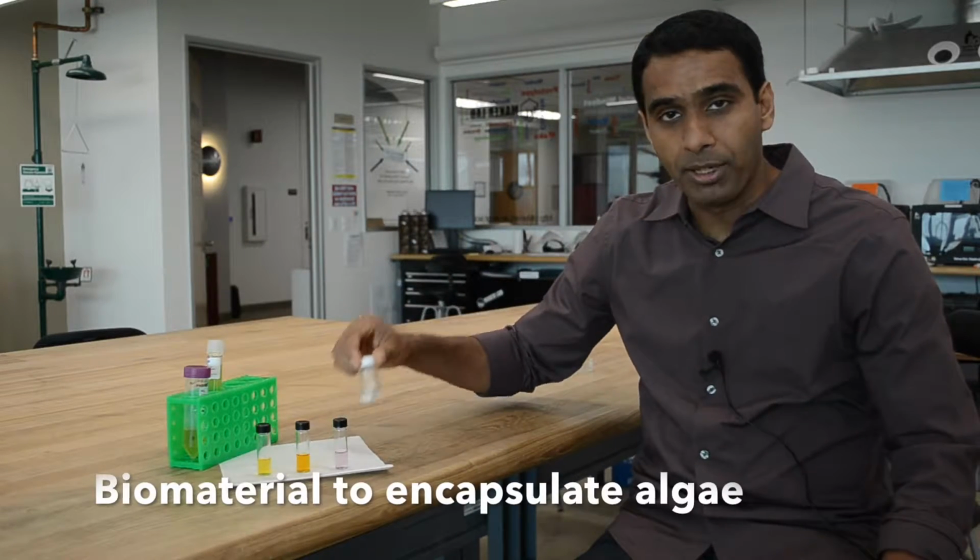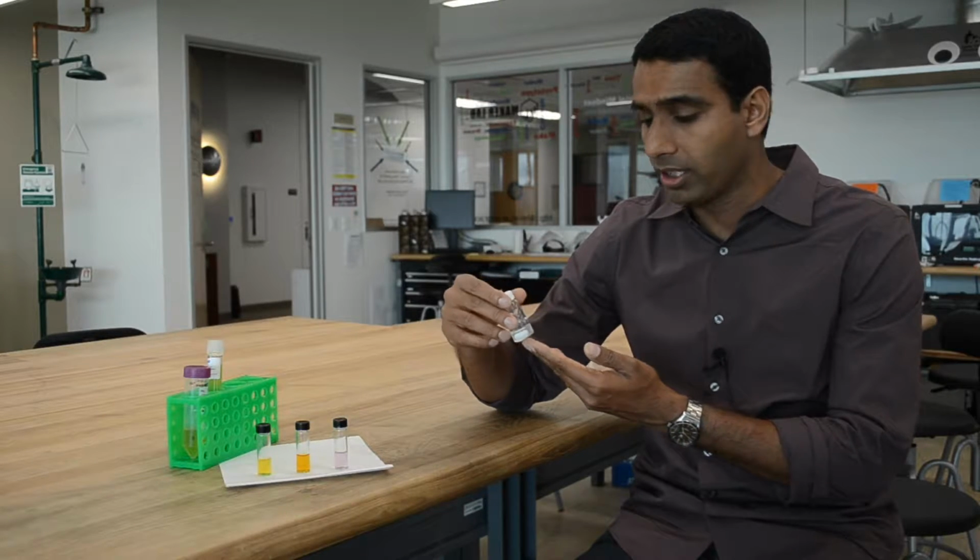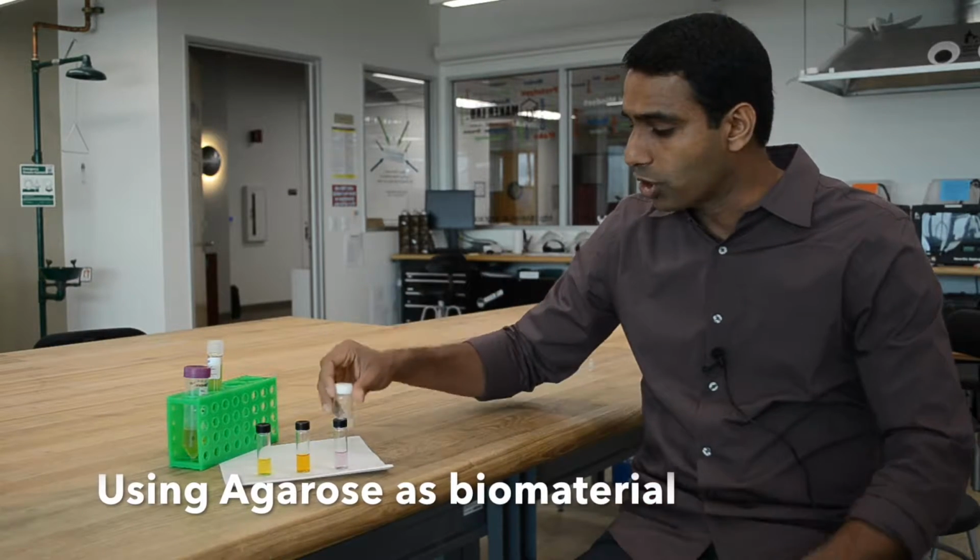We also need a biomaterial that's able to encapsulate algae into the array format, and we're going to use Agarose, which encapsulates algae and allows us to print algae in array format. And once we have printed algae, we also need a means to study photosynthesis or visualize the reaction proceeding.